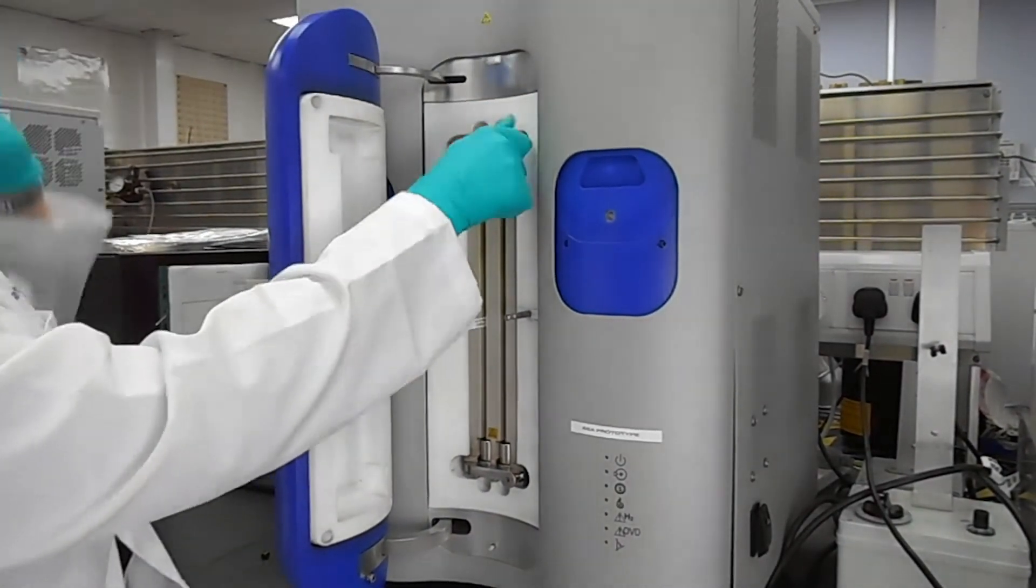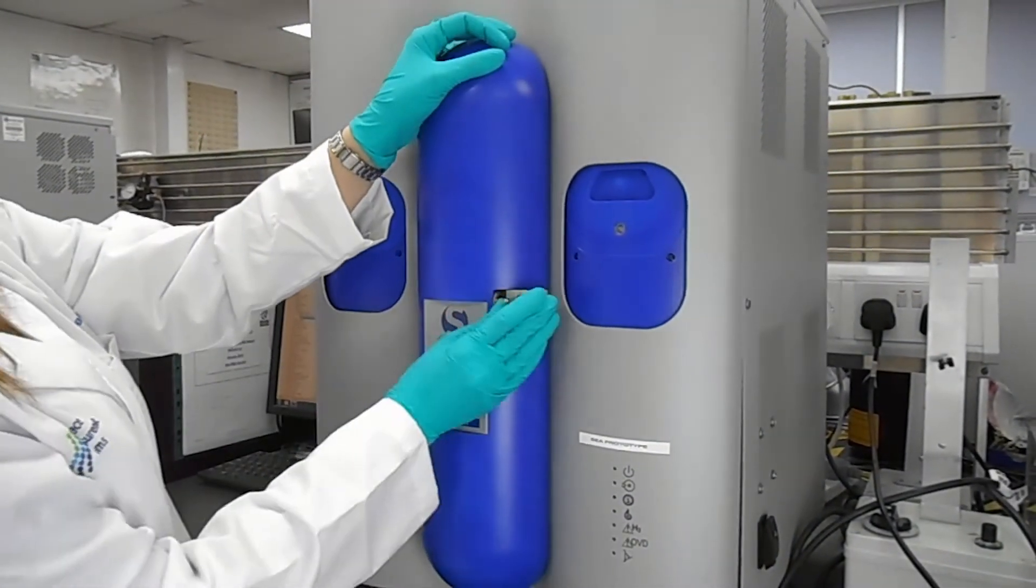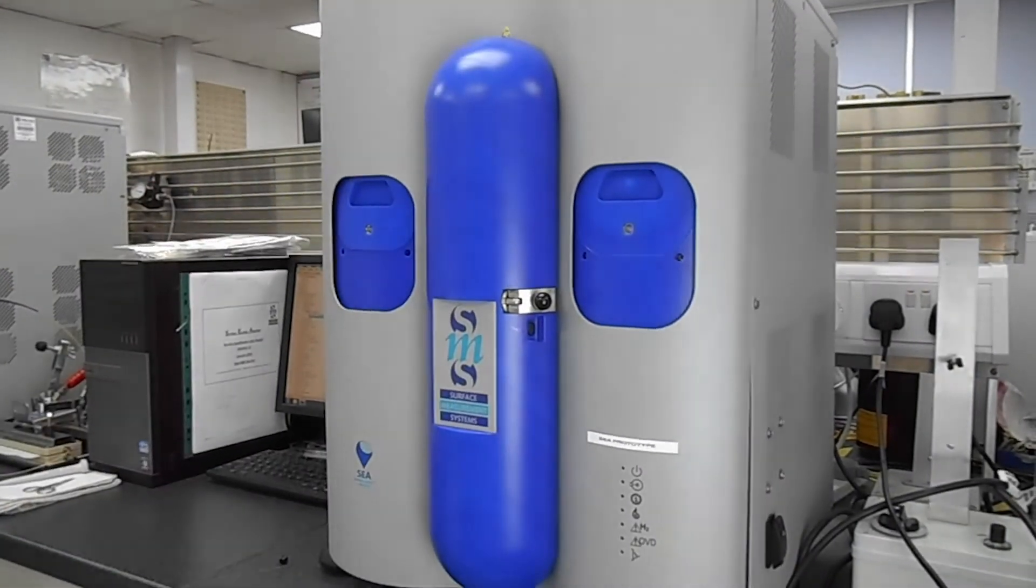The oven can accommodate two different columns and the analysis is carried out sequentially on both columns, one and then the other.